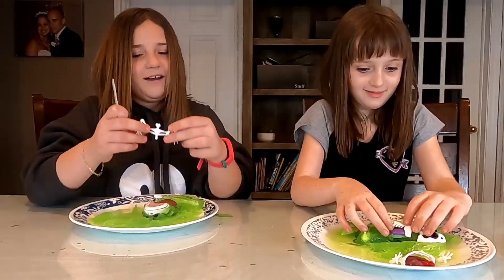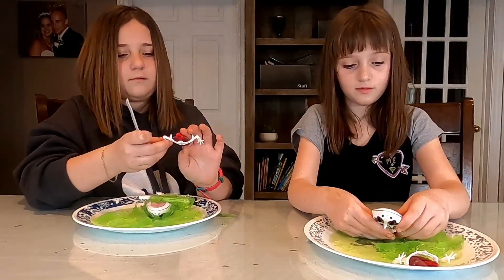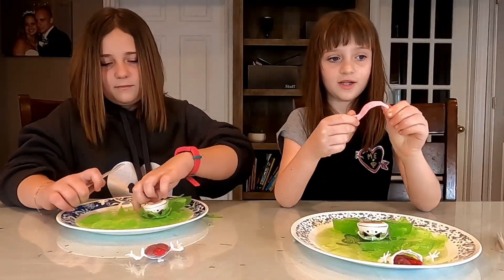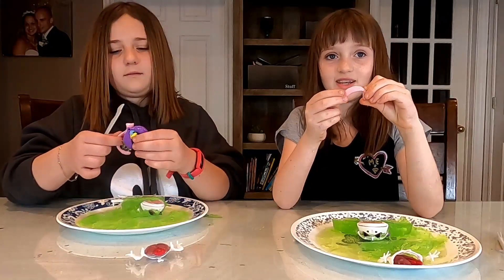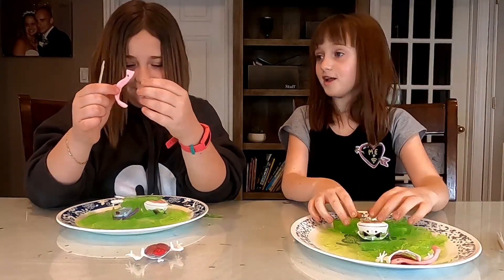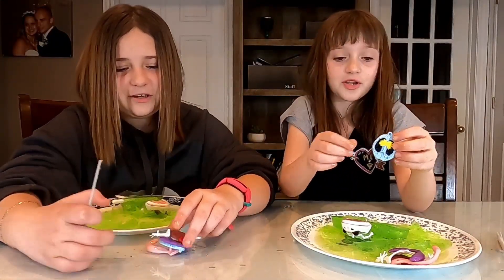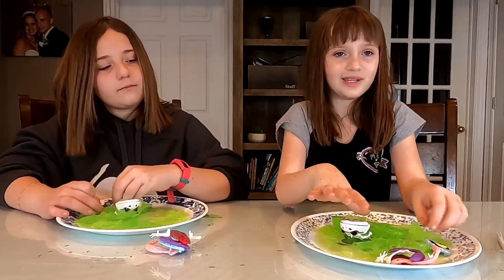So much gel. I got this part out. Alyssa got her arms — Miley's got a little bit of a head start, but I think the hard part for them today is going to be putting this frog back together. I got another piece but I forget what it's called. Intestine — I actually took the whole thing out. Spine? That definitely looks like the backbones maybe. Backbone, I'm guessing.